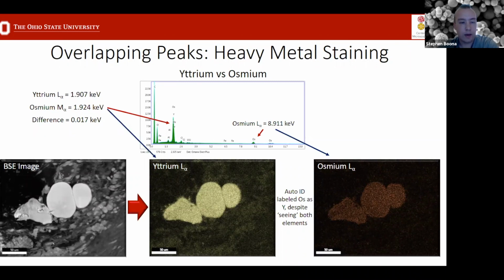And in that case, if it's looking for yttrium, as we saw in the previous one, it's going to label yttrium, even though it's not present. There is no yttrium in the material, but it's going to identify both automatically unless you go in and tell it to ignore that one. So be aware of overlapping peaks.